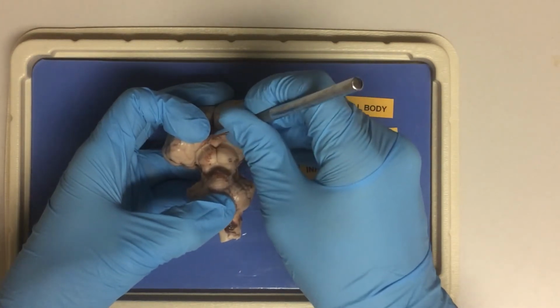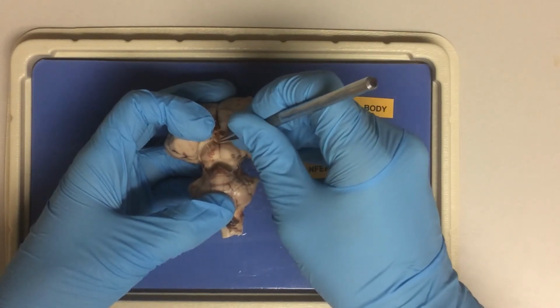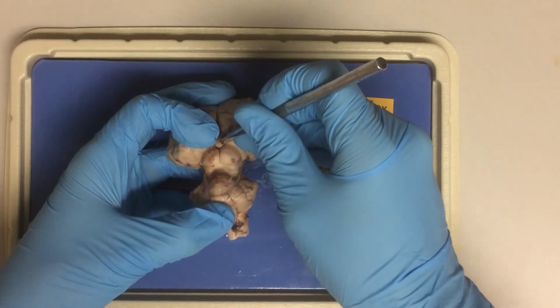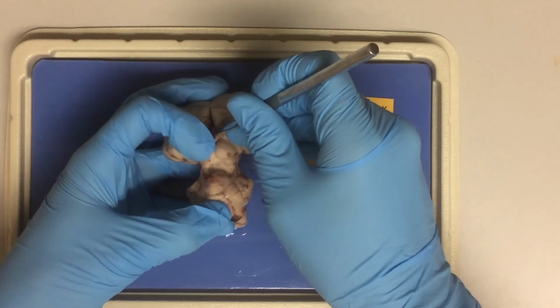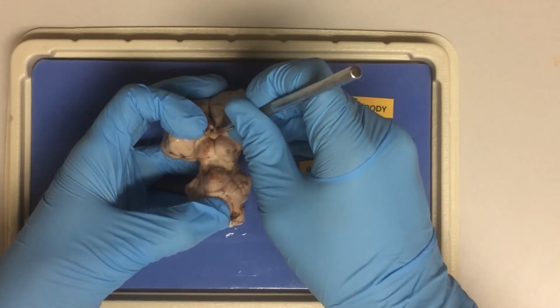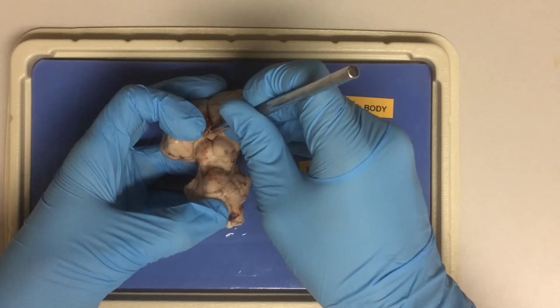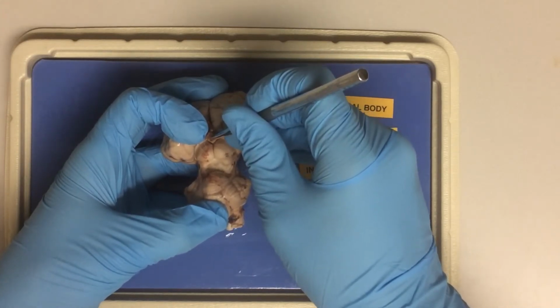Pineal gland here, which we also saw here, produces a hormone called melatonin at night. Melatonin is the sleep hormone, so this controls the sleep-wake cycle. If you travel over multiple time zones, you might need to take a melatonin supplement to adjust your sleeping pattern.